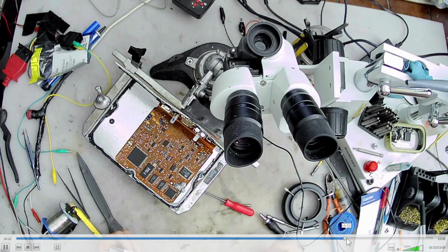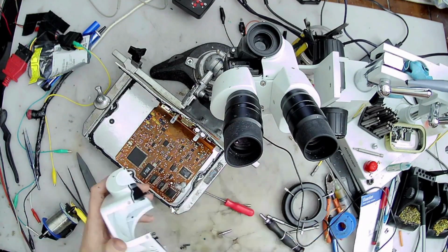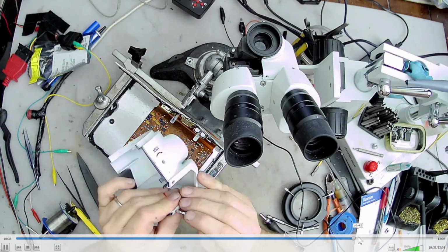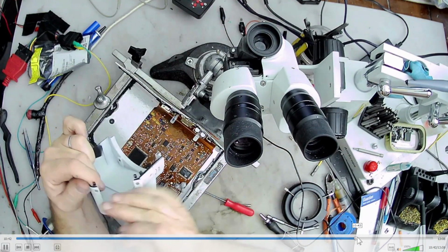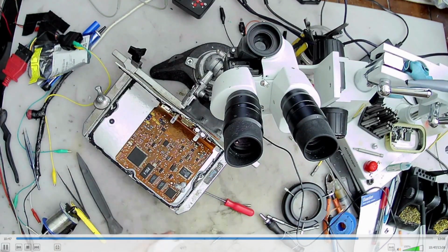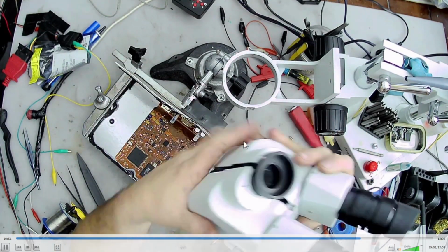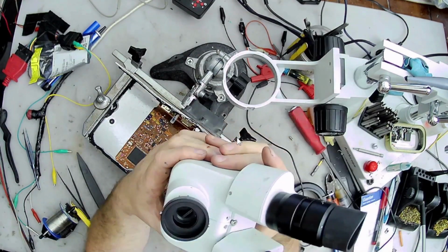Fast forward. I think this is me fiddling with the screw. Okay, so I got both of the little bars in. Oh, I only had one in. Yeah, that was a pain trying to get that little screw in there with that bar. That's why I really recommend when you take it apart, you only take off one side. And you will not have this problem. And you do have to put the case back on to test it again because of the light.